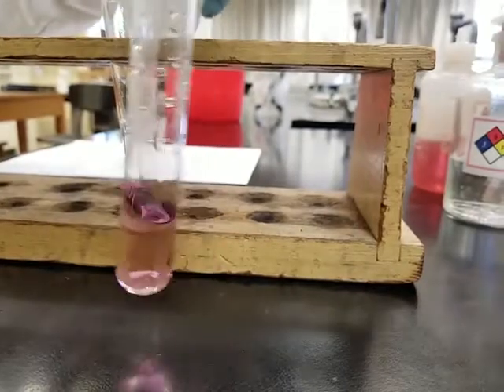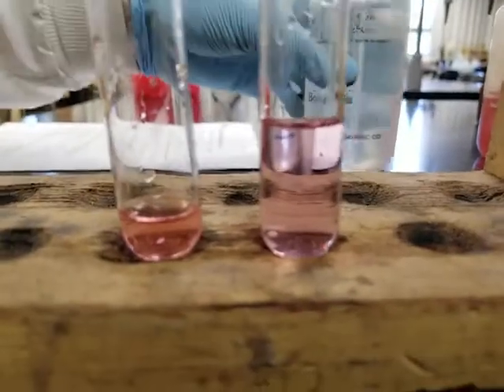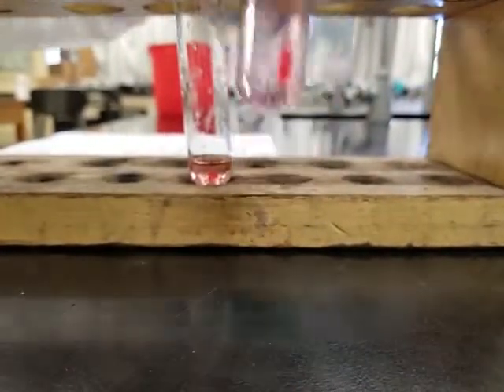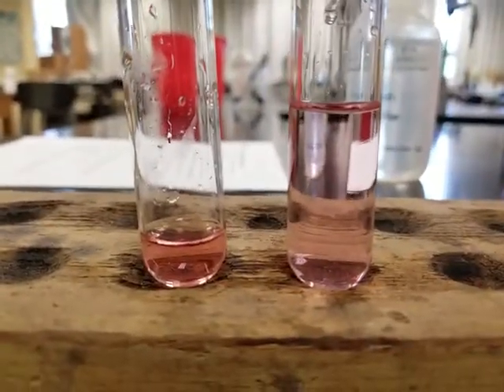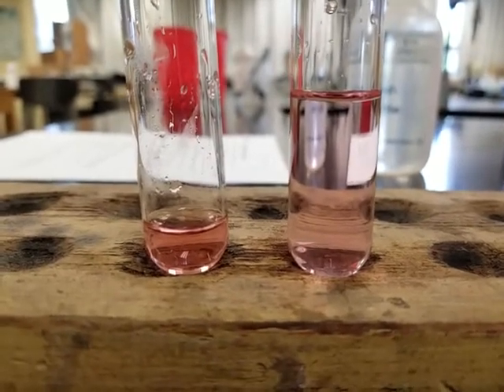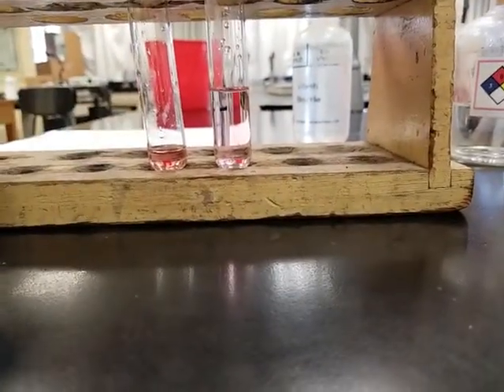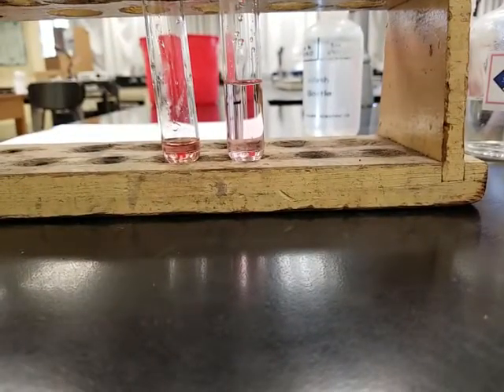Do you think this is restored? I think so. What about you? Do you think the color is back? Compare. Yeah, that's pretty close. We can add a couple more drops of DI water if we want to. Now it's back. Okay, it's back to its original color. Okay, so basically what you did is you just disrupted the equilibrium by adding HCl and disrupting it again by adding DI water. So that's what you did. So based on the results that you're seeing, you should be able to complete the rest of this page. All right, good luck.